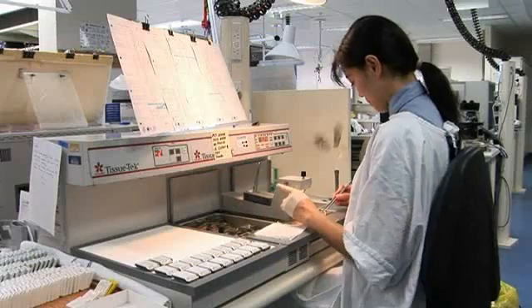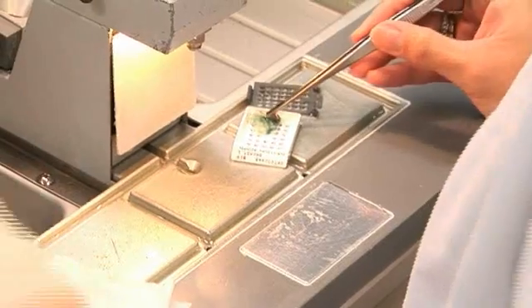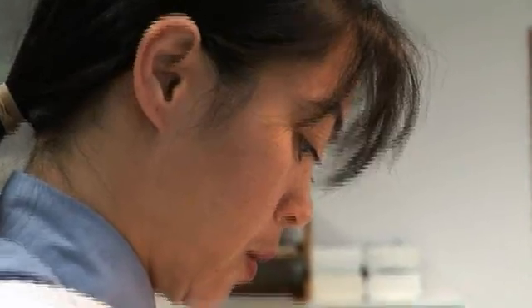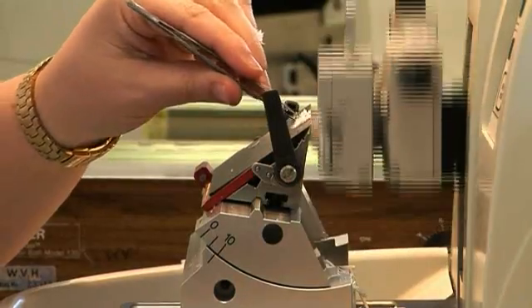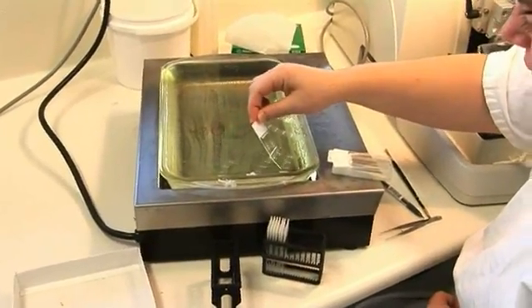Following the fixing, the tissue is then dehydrated slowly. Generally on the second day, once it has been dehydrated, the tissue is then embedded in hot wax to form tissue blocks. These blocks are saved for many years for later revisions and reviews should they be required. A very thin section of the tissue is then cut from each block, placed on a slide, and stained with two different chemical stains — hematoxylin and eosin.